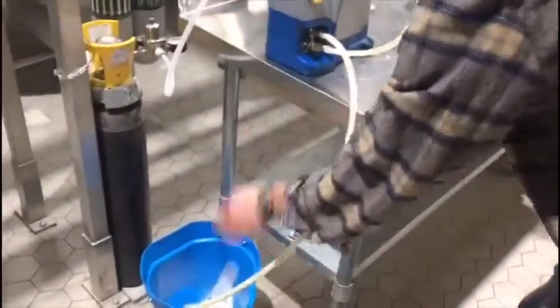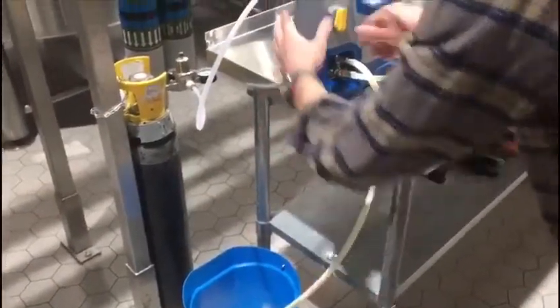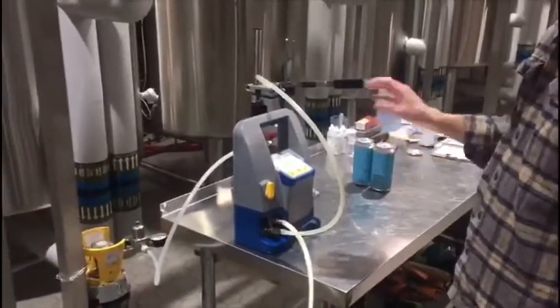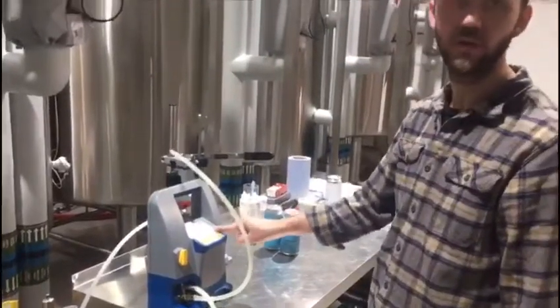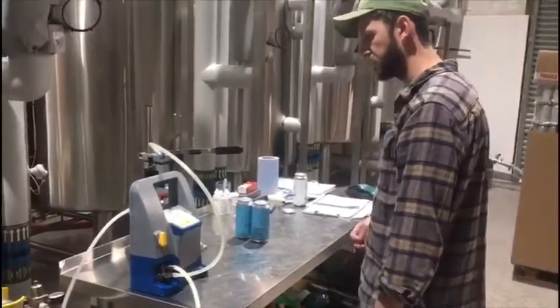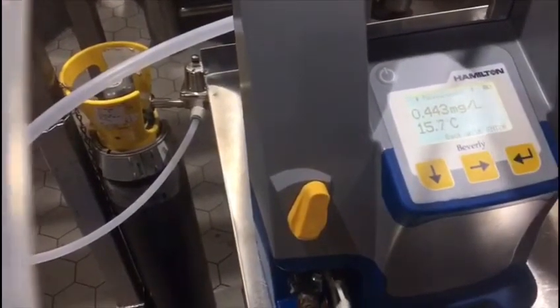We make sure we've got a slow flow through the machine. We use one to two cans to chill the DO meter down so that the temperature stabilizes and the oxygen levels come down. After that point you can measure five cans in a row without an issue. The DO is coming down really quickly but it's not all the way down yet — hence the burner can.